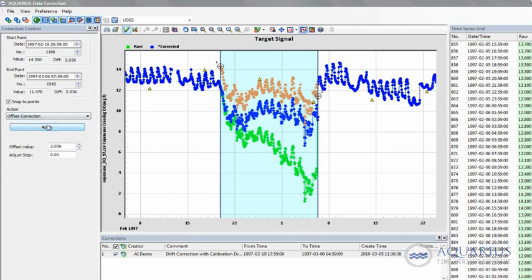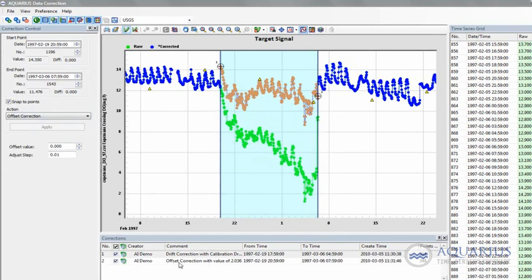And again we hit apply, hit OK, and that correction history manager records that second change, and it's updated both the graphical representation and the grid view format too. And that concludes the corrections of drift and offset corrections.